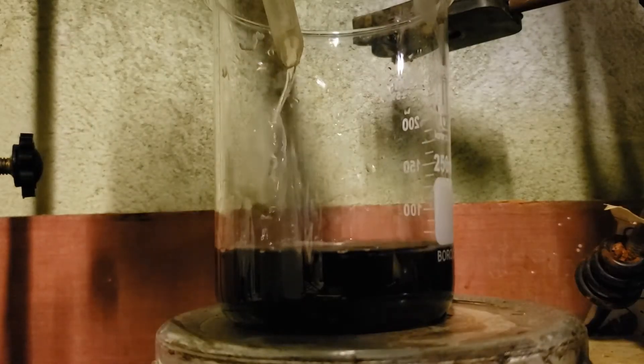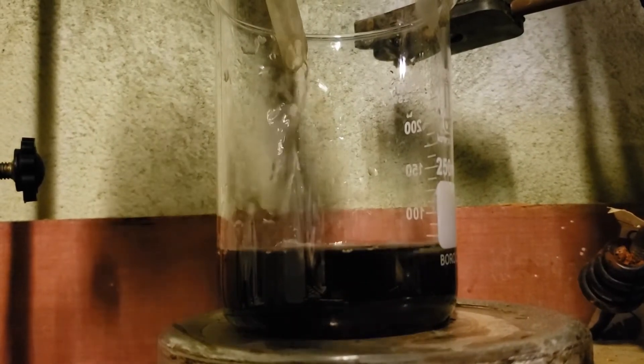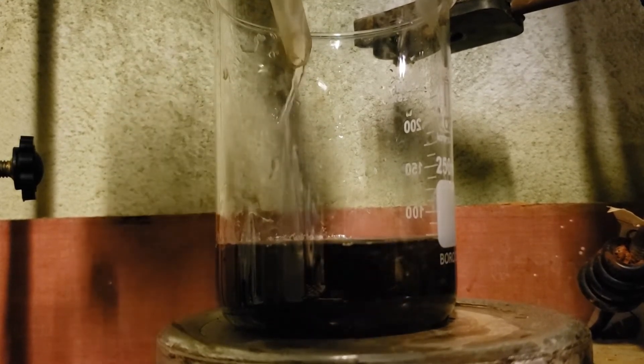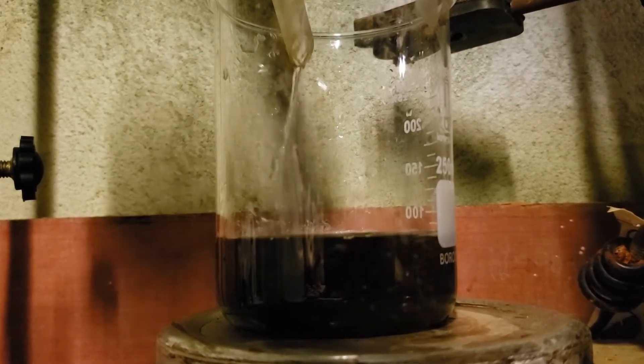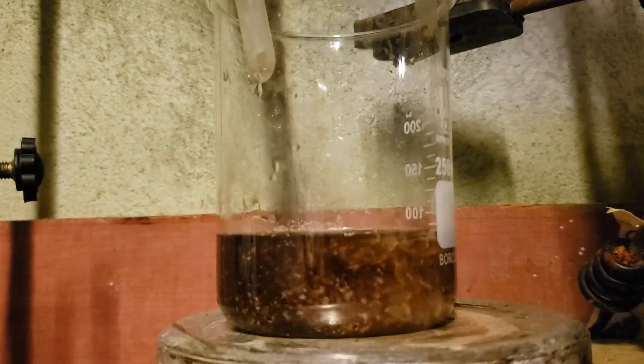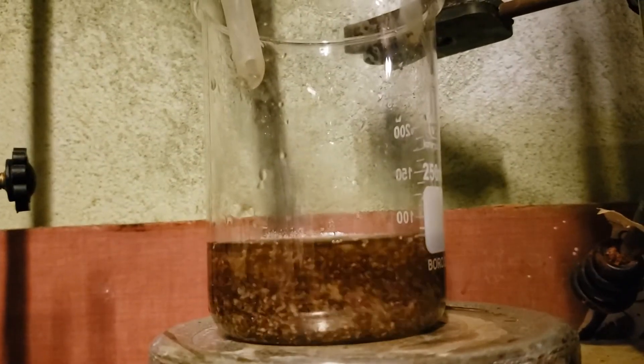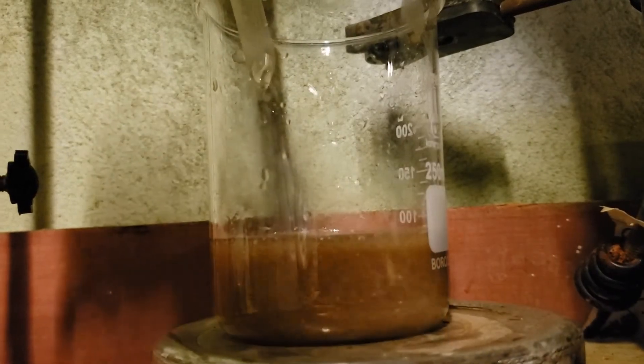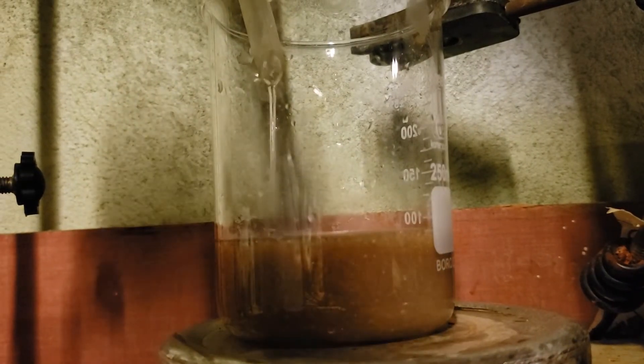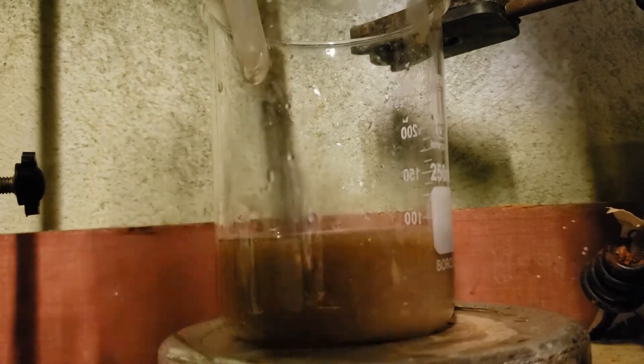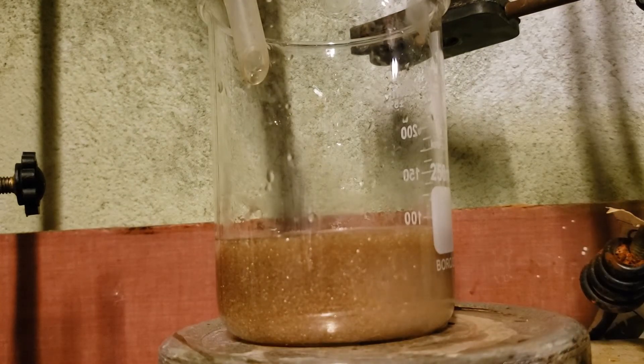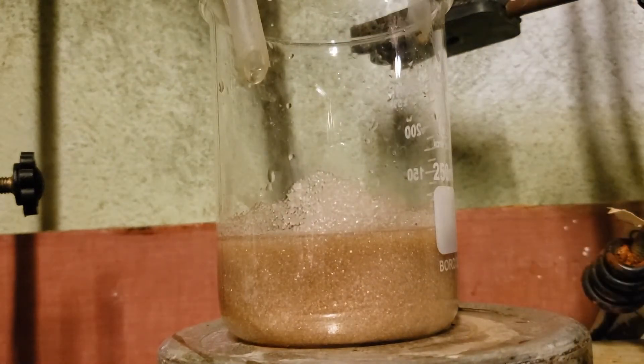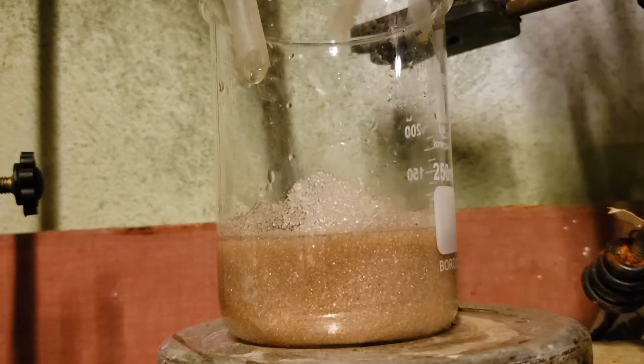A quite stunning precipitate of product formed.